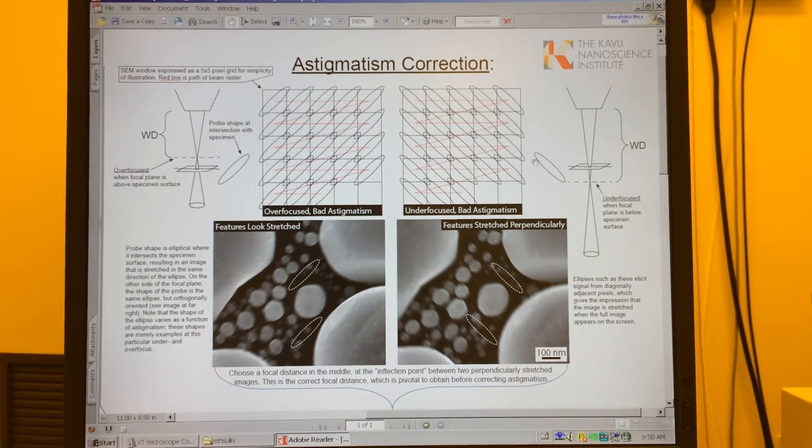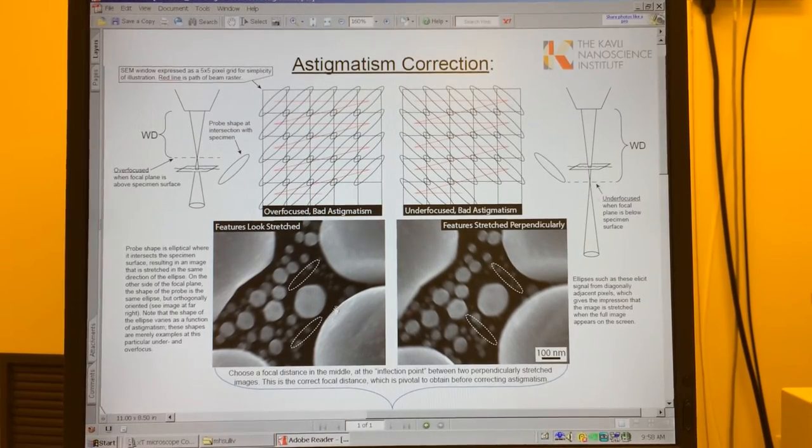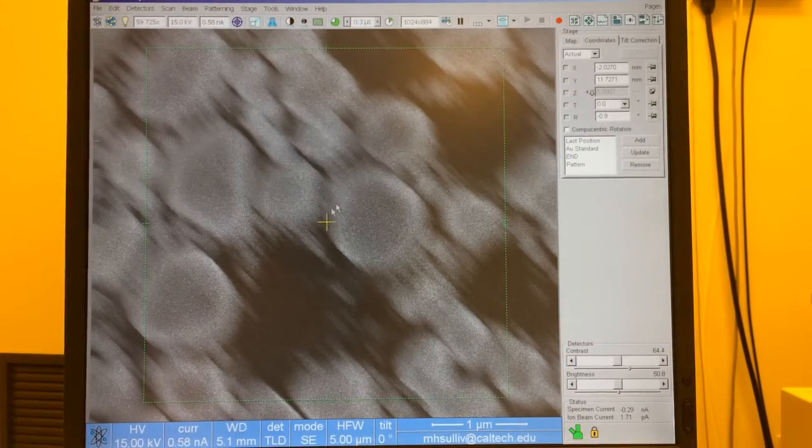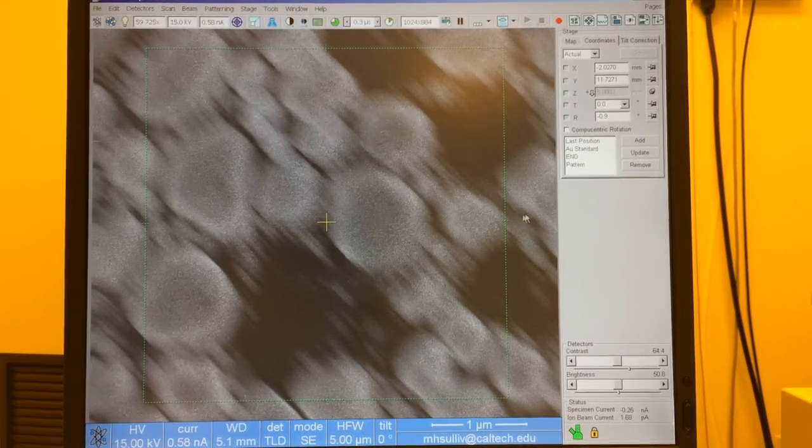with respect to the bottom side of the focal plane. So if we take this elliptical shape and step it along our 2D image, now we're pulling signal from not only the pixel that it's contacting, but the pixel to the top left and bottom right. And so along this edge of this particle, that's going to be sharp, and you can see that's rotated 90 degrees from, for instance, this edge. So we can go into our SEM image, and we can see that now that we have sharpness along that edge.